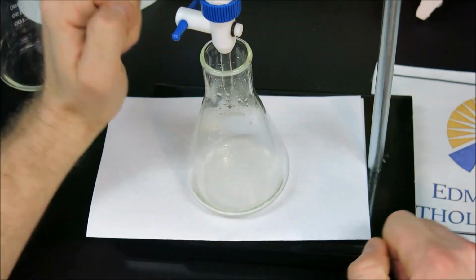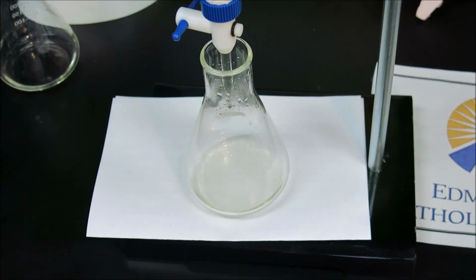And in this case, one more time we reach the yellow endpoint. However, we do know that by going one drop at a time, that yellow endpoint has been demonstrating to be fairly close to the endpoint of green. So we'll check the volume.